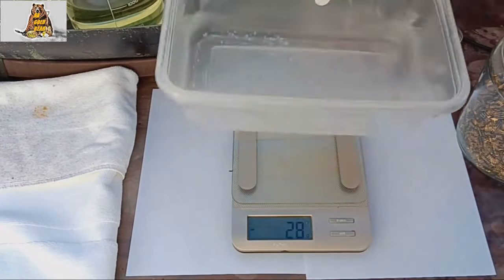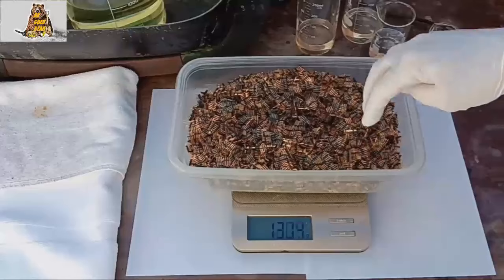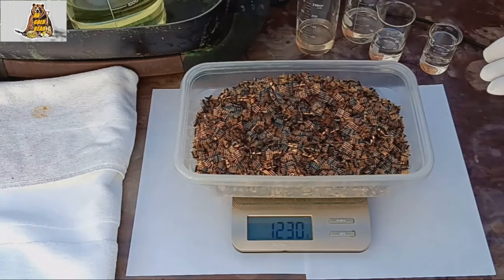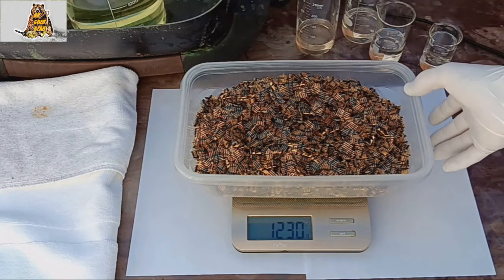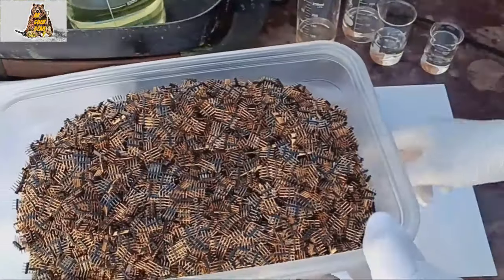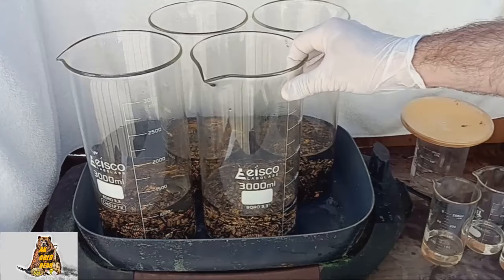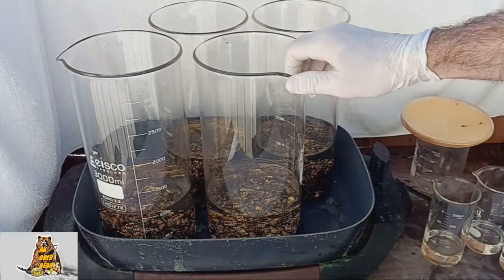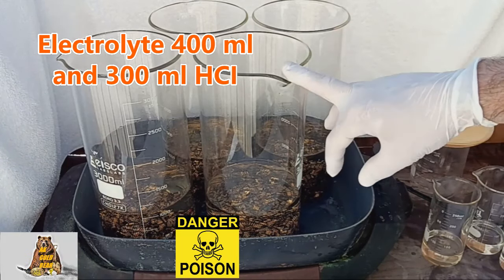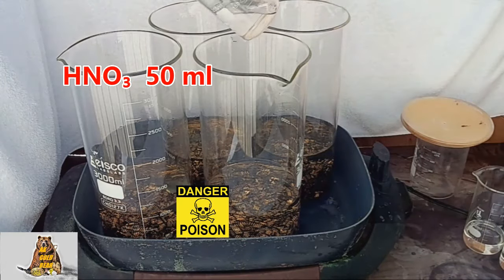I need a big container. I have 1230 grams. Do you think it's possible to get 5 grams from this material? I divided the material into 4 beakers. My acid solution consists of 400 milliliters of electrolyte and 300 milliliters of hydrochloric acid, and I will add 50 milliliters of nitric acid.